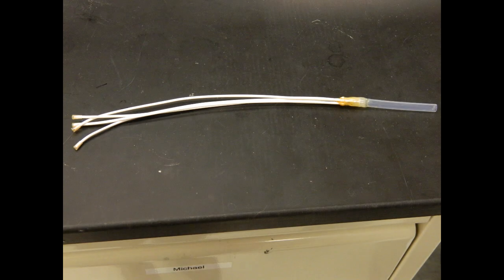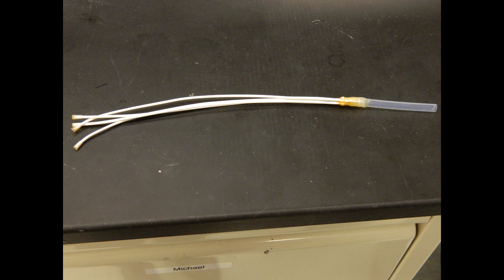You can see the fully assembled hollow fiber assembly here with the plastic on the top and hollow fibers sticking out of the bottom.